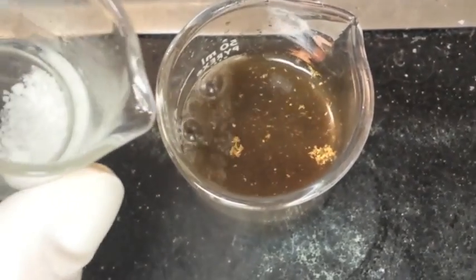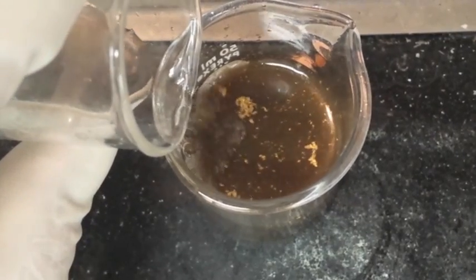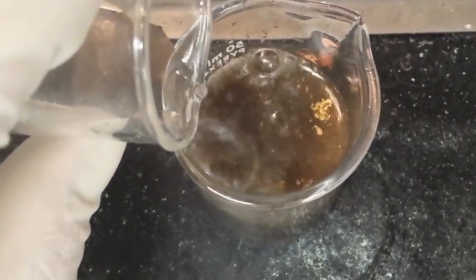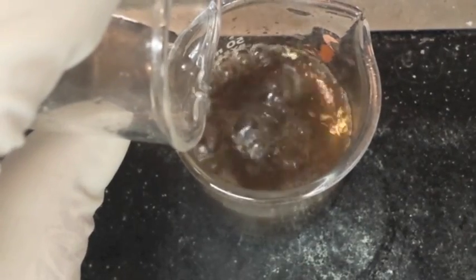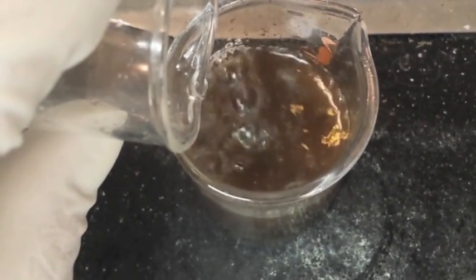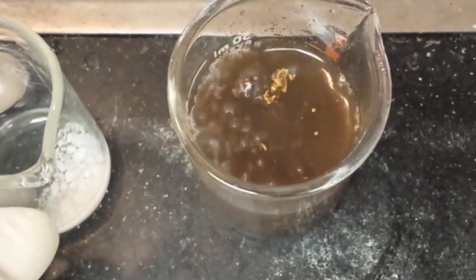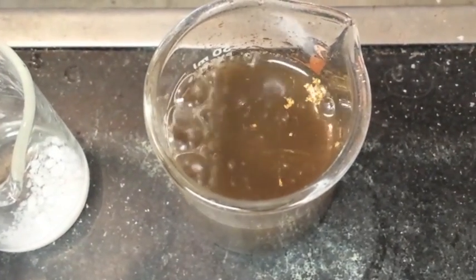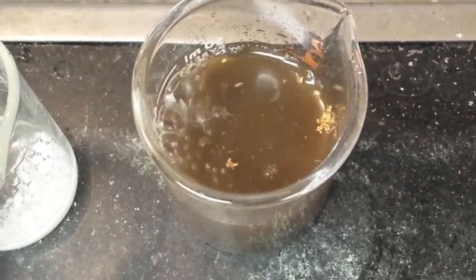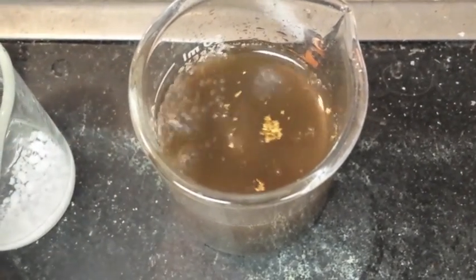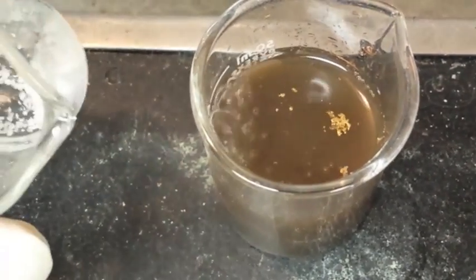Do this outside or under a fume hood, away from anything. This produces extremely noxious fumes, toxic, and you do not want to breathe them. Very nice. That's exactly what we want. Continue adding the sodium metabisulfite until it's all gone.